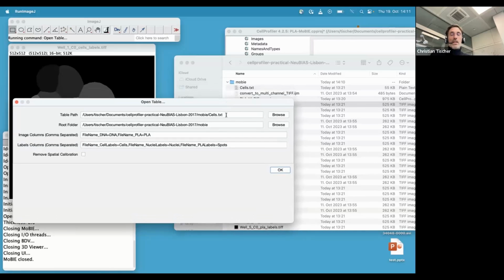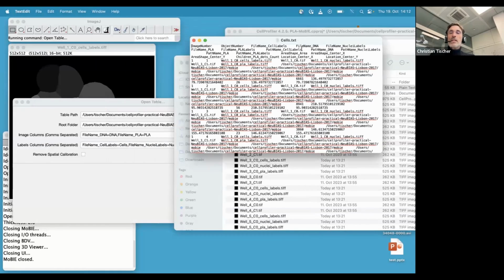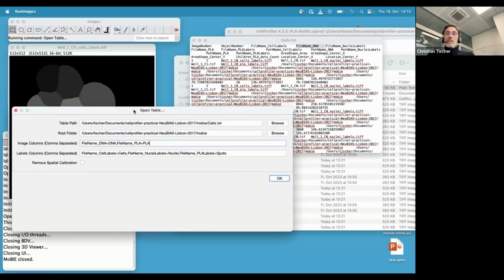And it is the cells table that we just stored from CellProfiler. Okay, this is just the plain CellProfiler output, no modifications. And then what you have to do is tell MoBIE which of these columns contain the file names of the images that you want to open. Okay, and I can open this in just a text editor. You see it's just the file names that CellProfiler gives. So you have to tell it. This is not automated because, as you see, the title here is actually not open CellProfiler table, it's open table. Okay, so the idea is that this is generic and would work for any reasonable table that you create with any other software. So there's nothing baked in the Fiji plugin that's specific to CellProfiler at that stage.